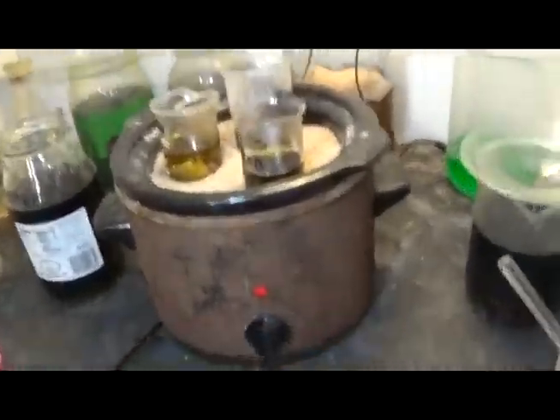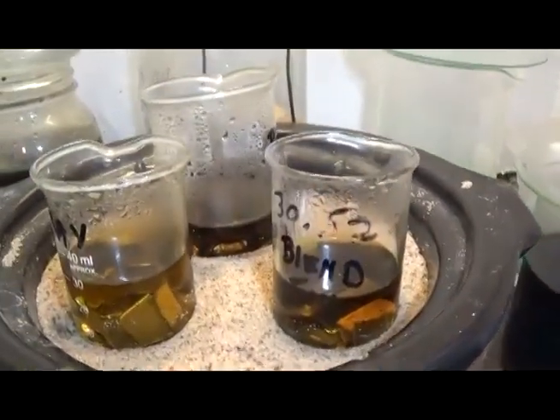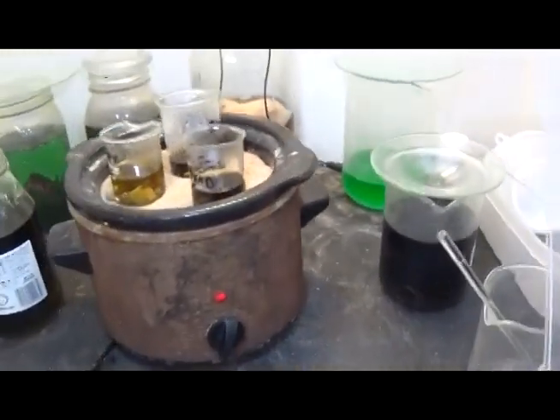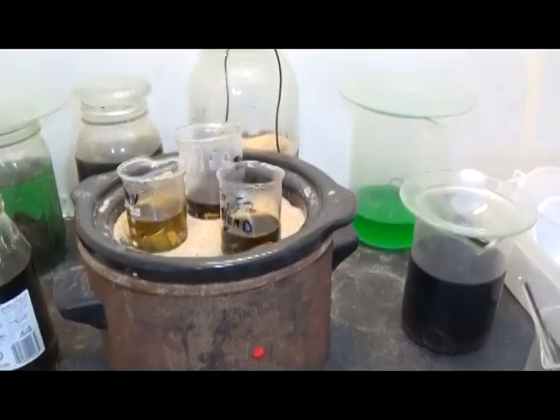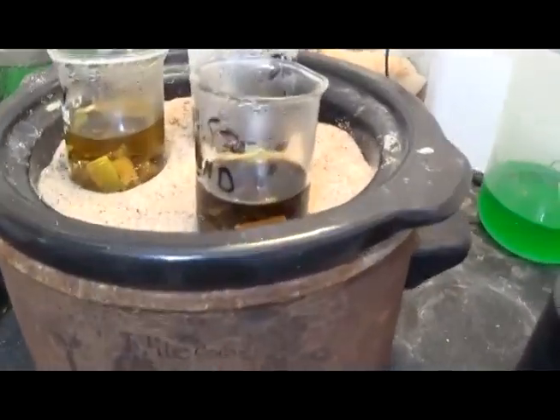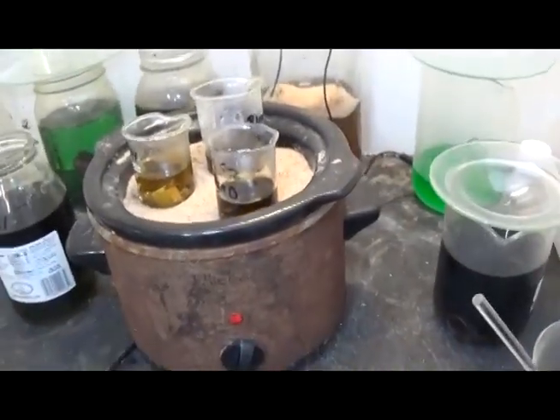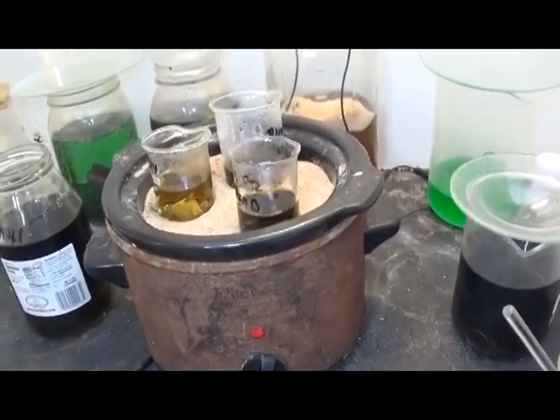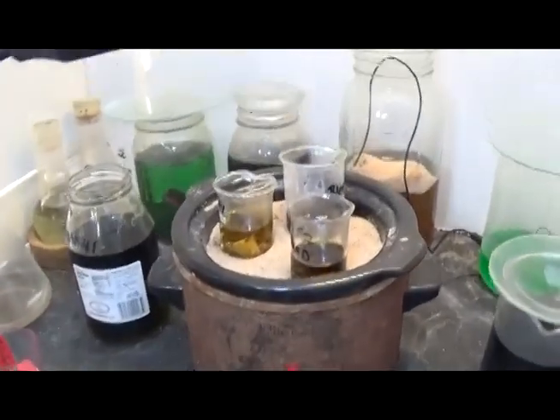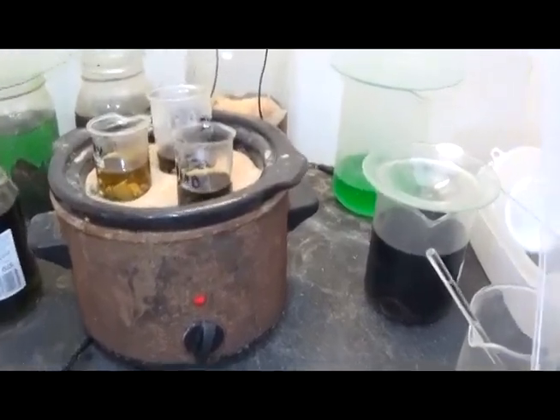Update on the experiment. The dilute blend in the back seems to be the darkest, which is the best. Seeing minor gold foil separation. We're looking at about 15 hours that we've been on the heat. I did secure the heat last night because I just don't trust this thing running while I'm sleeping.